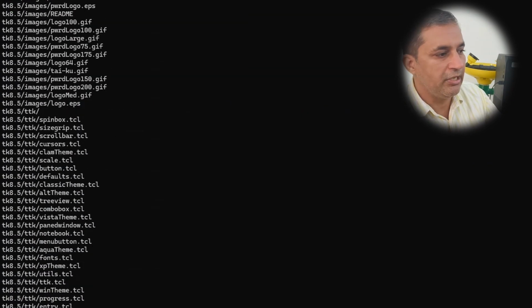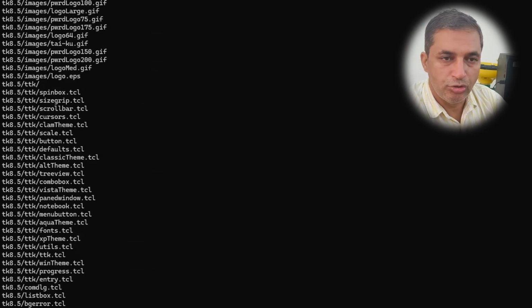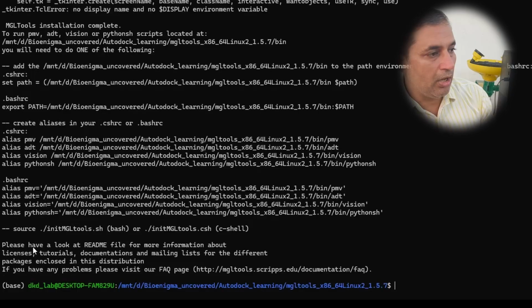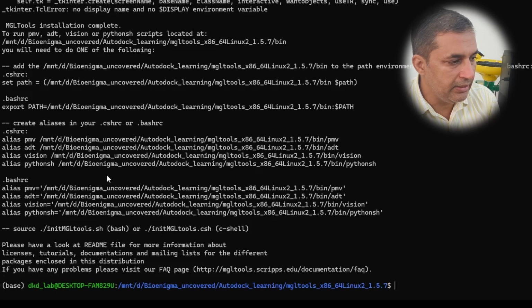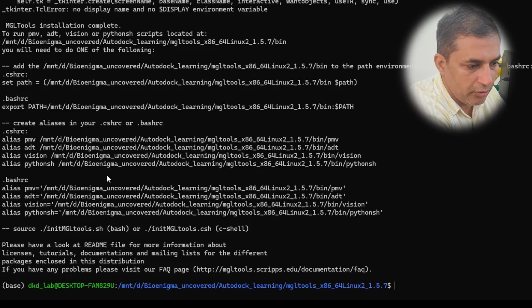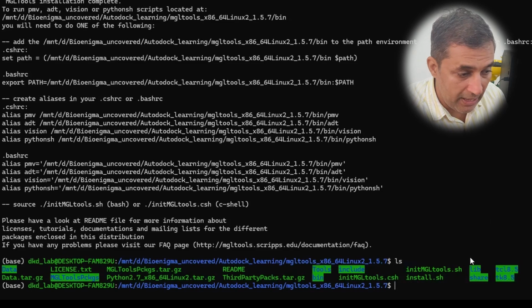Hit the enter button. You can see on your screen all the components are now being installed within your system. It will take a few minutes. So now you can see here very clearly that our installation process has been finished. I'm going to type this command ls. You can see various packages.